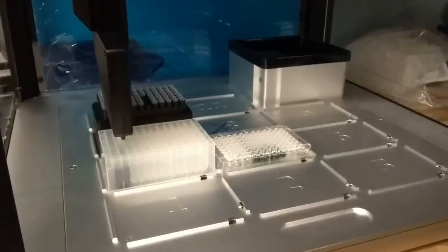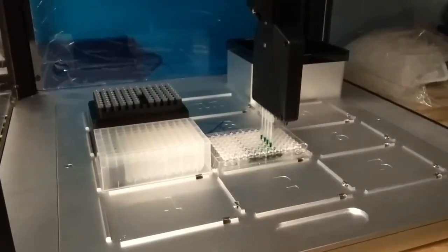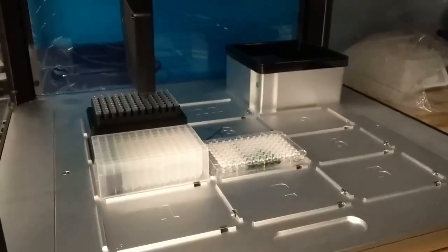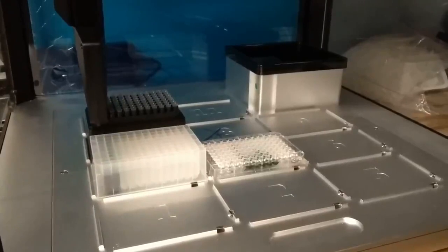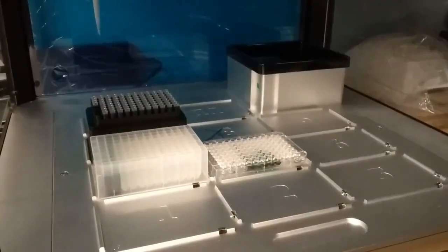Finally, our dialect device connectors will translate that optimized protocol into the specific instructions for your liquid handler, in this case, the Opentrons. For this demo, we have Weaver configured to re-rack tips, since here we're just working with food coloring and want to conserve consumables. After each pipette operation, it'll replace the tips in the correct place in the rack.